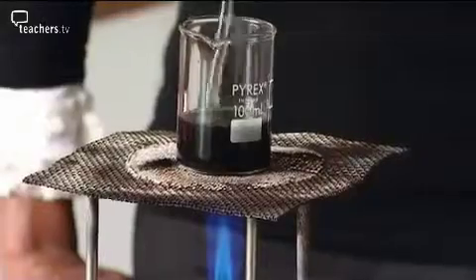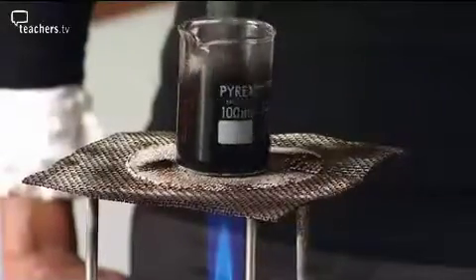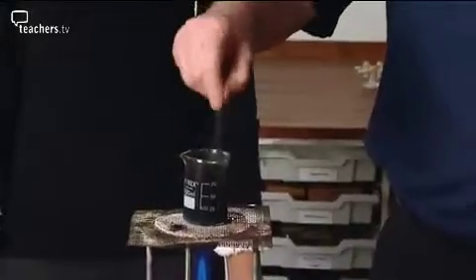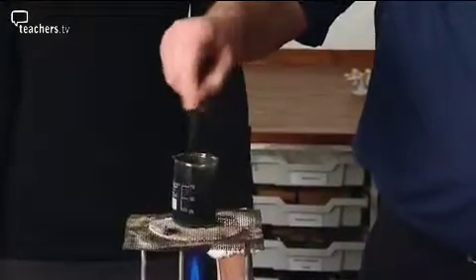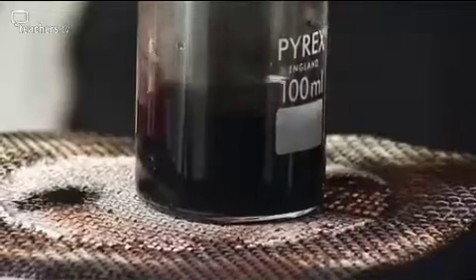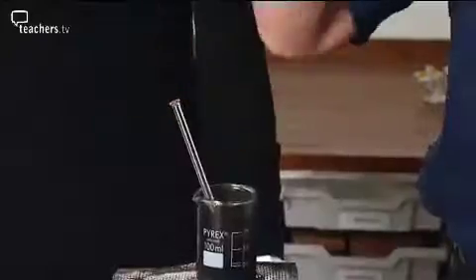They should be looking for a blue solution to appear, but they're stirring it and it still looks black. Having added too much copper oxide, the students are still trying to get a reaction. They tend to stir very violently, like this, and they can upset the beaker. The suspension is now far too hot. Oh, it's getting hot.